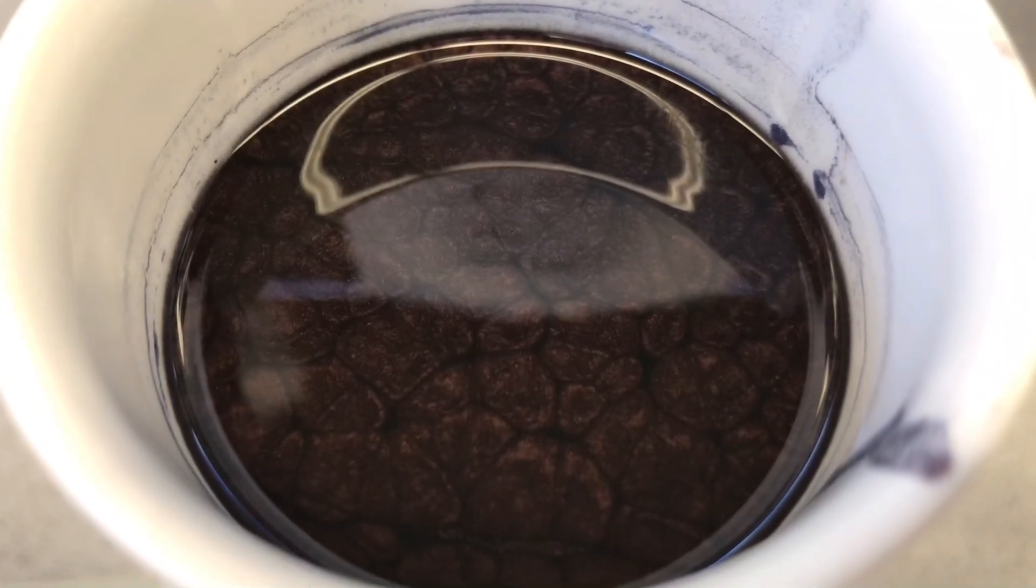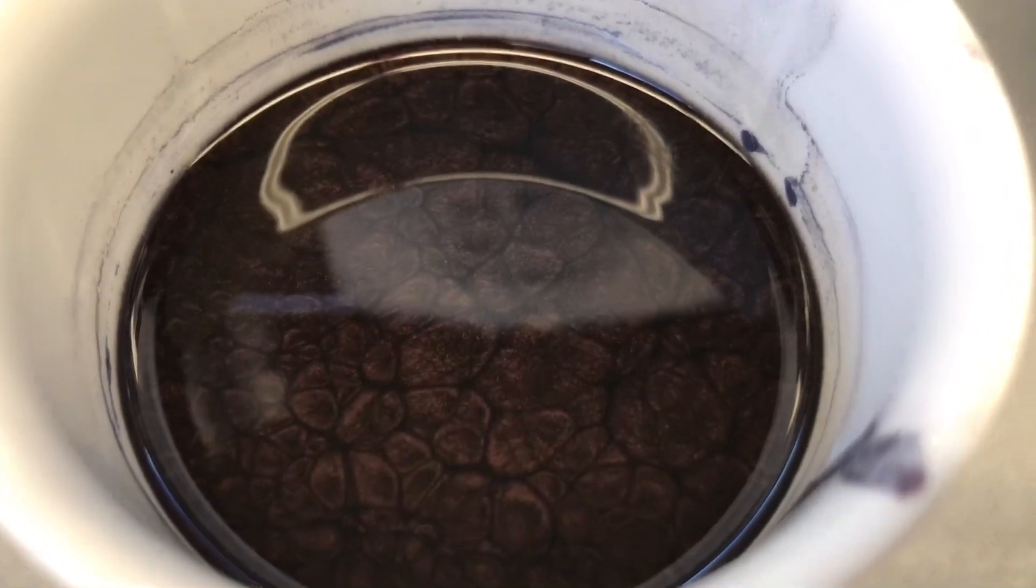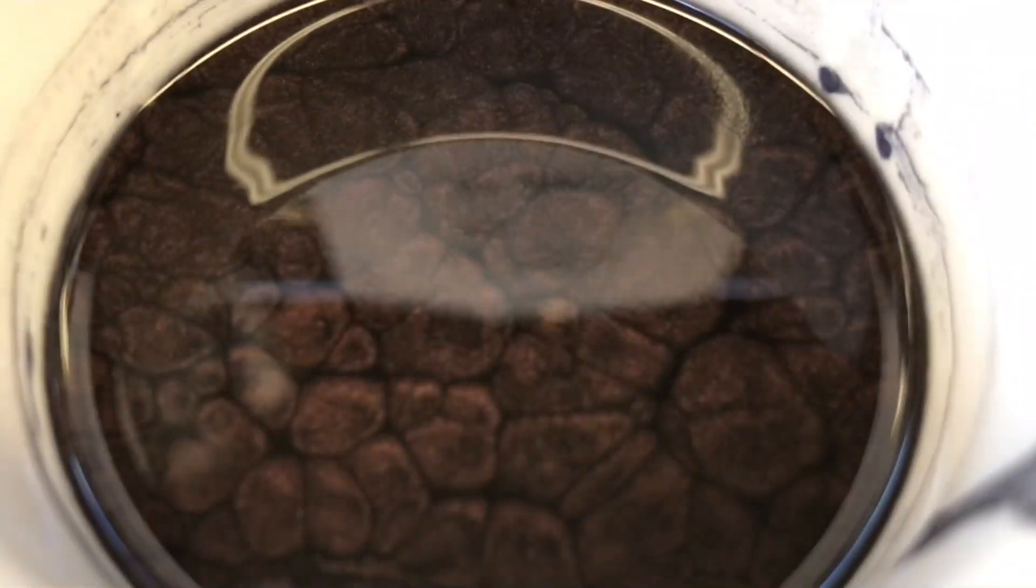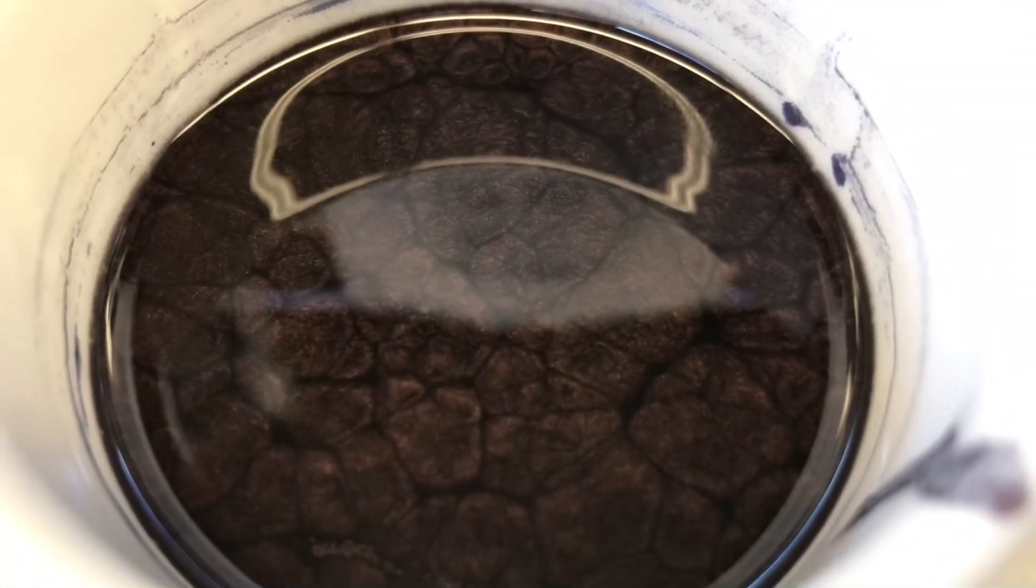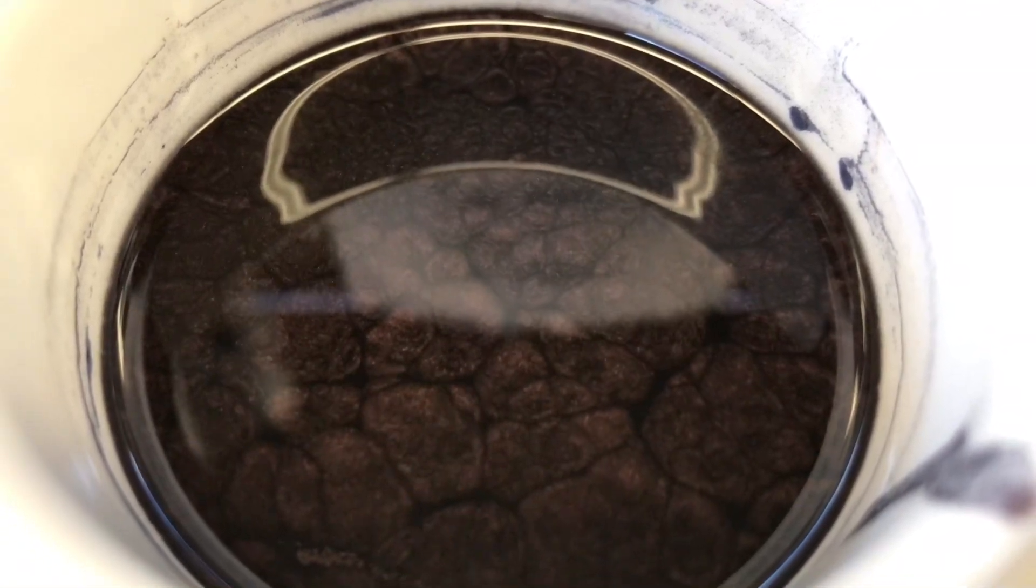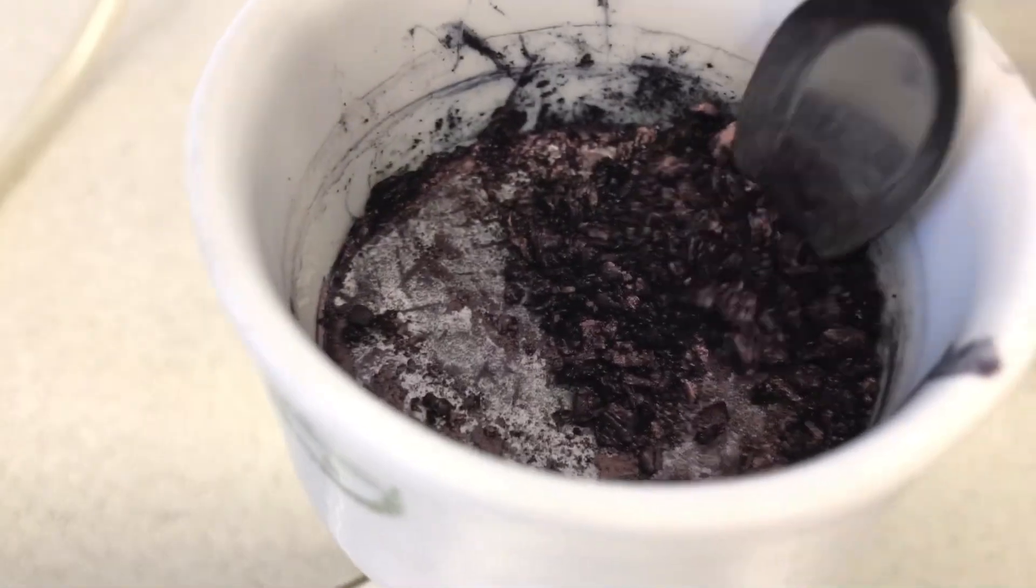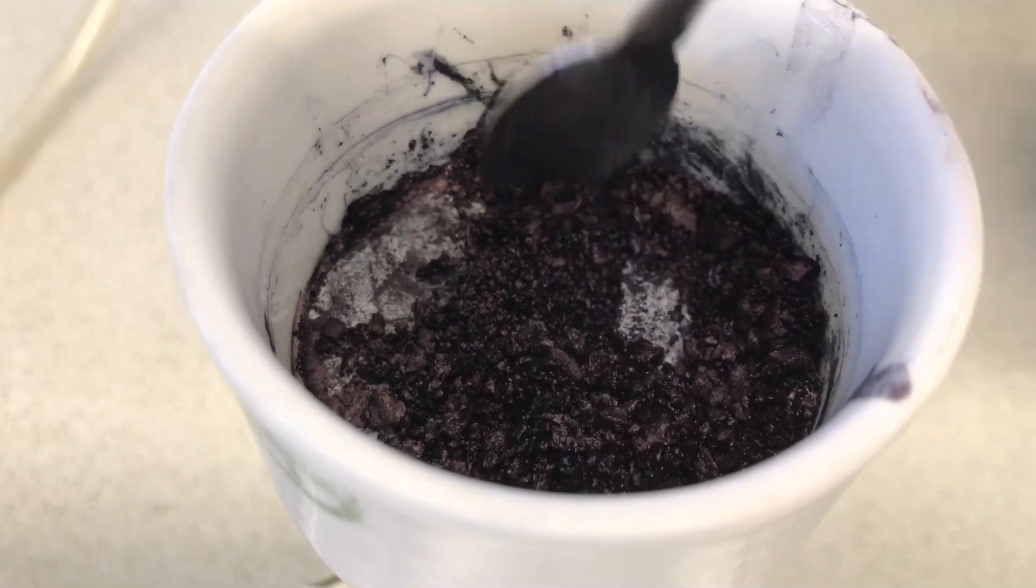It made this a really interesting effect. I simply had to film it. Fine particles created this strange pattern, which was full of motion. Once the filtration was finished, another ether wash was performed, and this is the dry product.